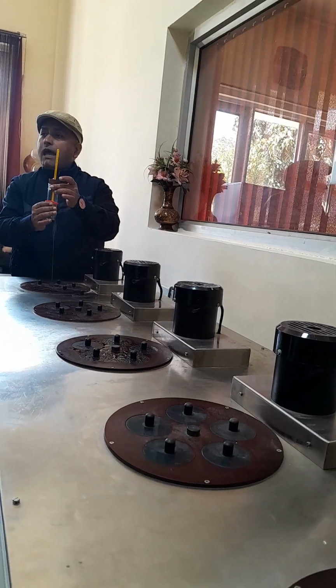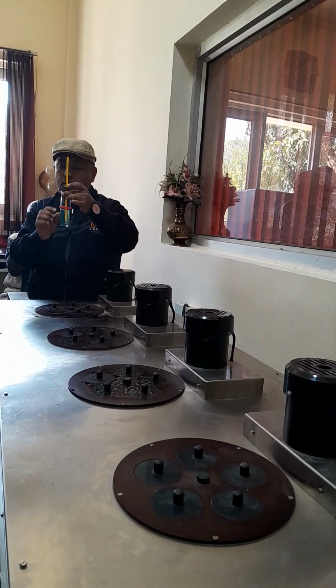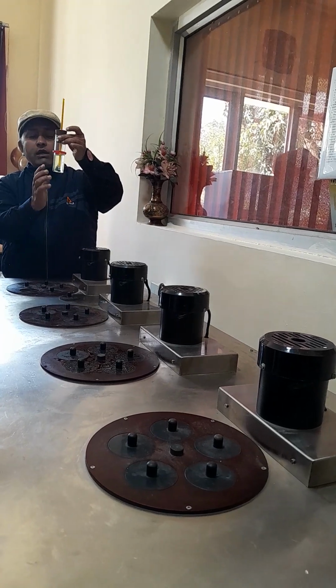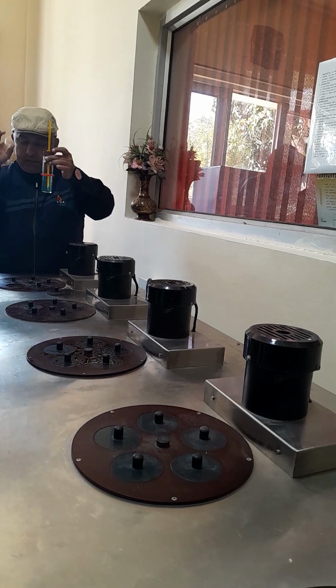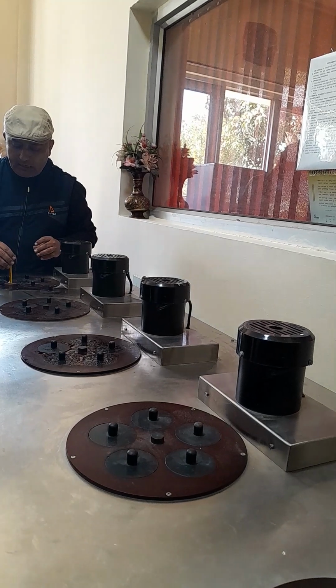No, I am using it so that the other surface of the tube should not be in contact with cooling. If it is in contact with air, no cloud formation will be there. First cloud will appear over here. So it should not be in direct contact with cooling. So I am keeping it on this side.